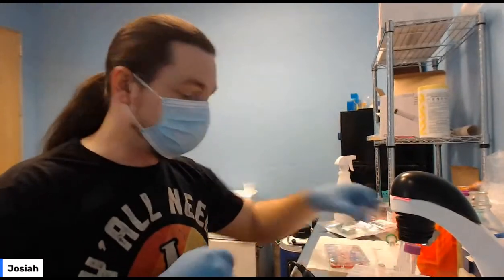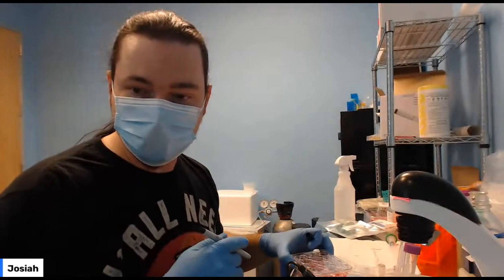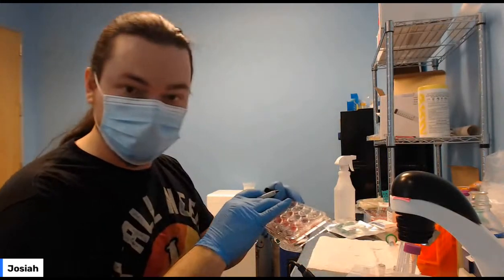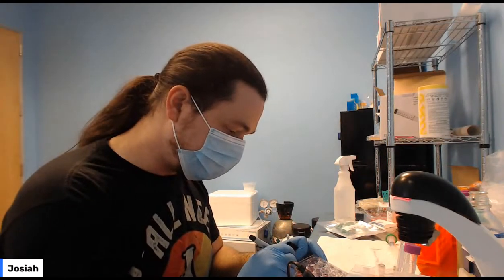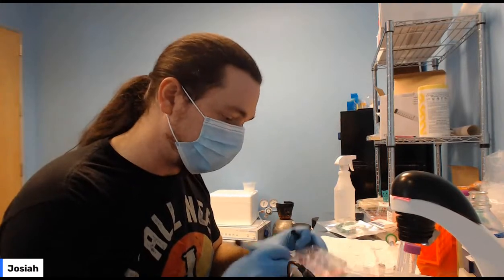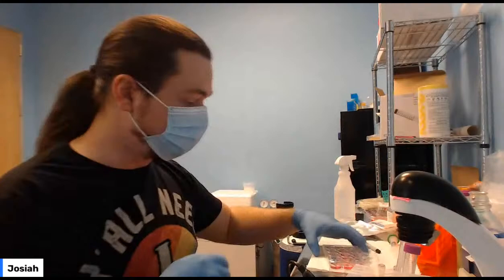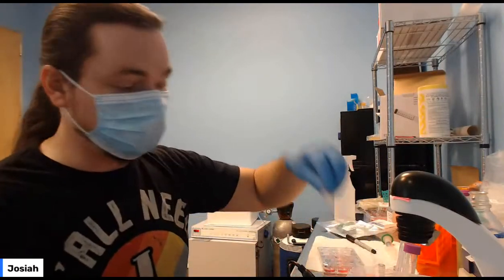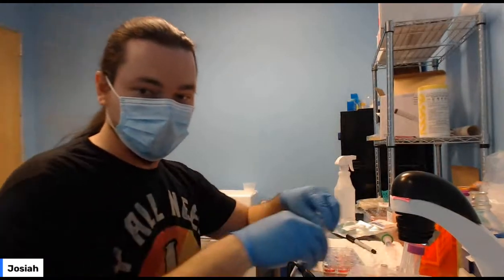What you're going to do is mark which plastic you're going to use. So just put plus, minus, minus. That's going to tell you which ones you're going to use the plus for and which ones you're going to use the minus for. Remember, pluses have the DNA, negatives did not have the DNA.